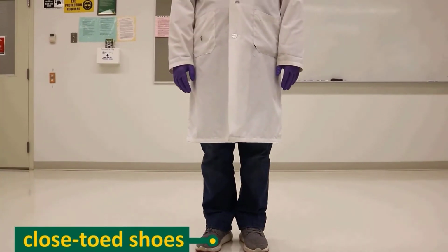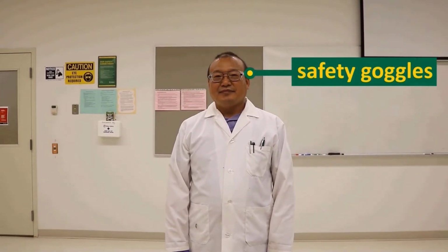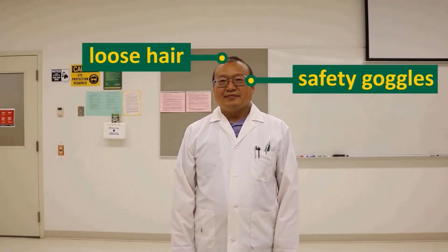Please wear all required PPE at all times in the lab: lab coat, gloves, safety goggles, and with long hair tied back.